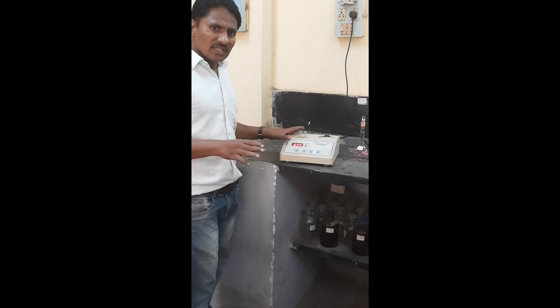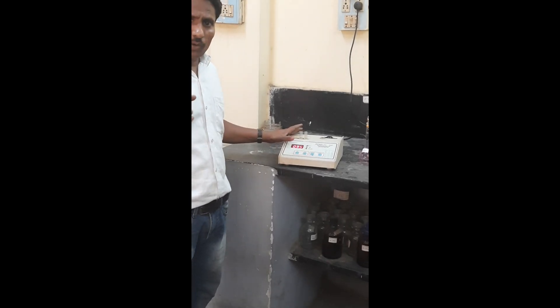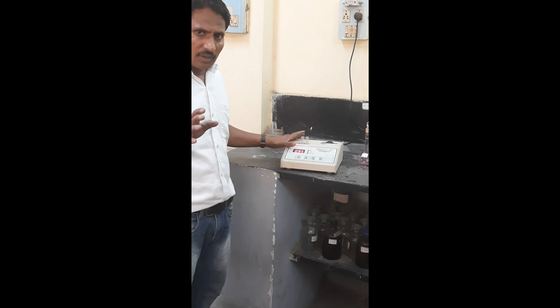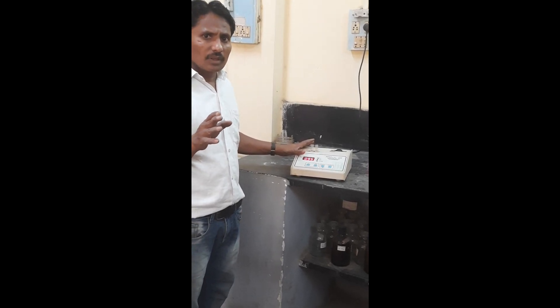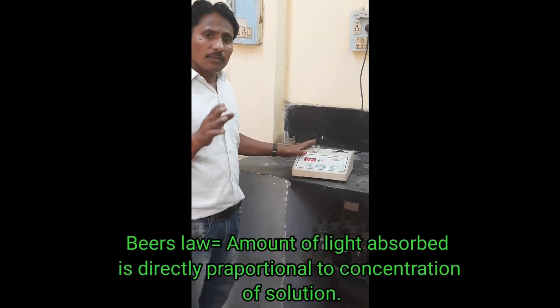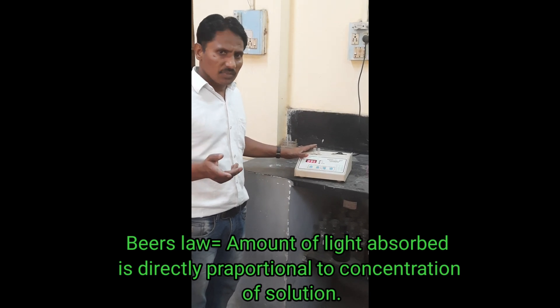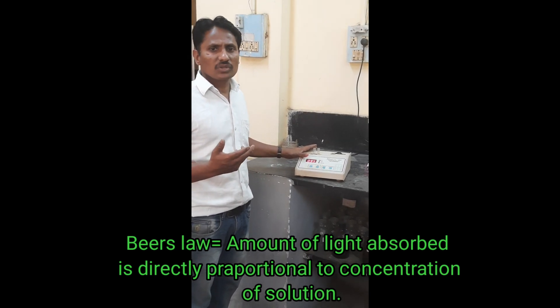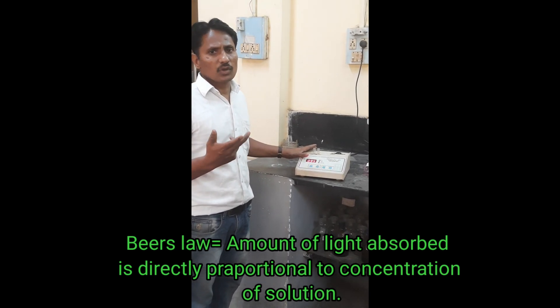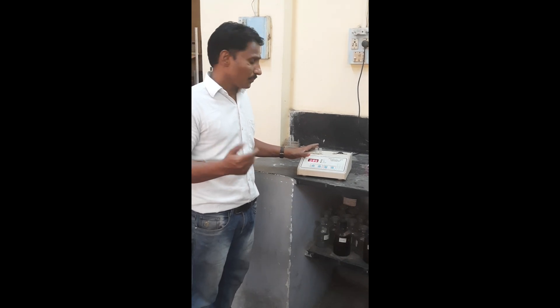The colorimeter is based around color — specifically, the absorbance of color. It is based on Beer-Lambert's law. As the concentration of a solution increases, the absorbance of the solution increases. That is Beer-Lambert's law.